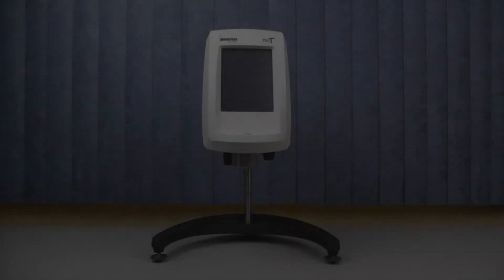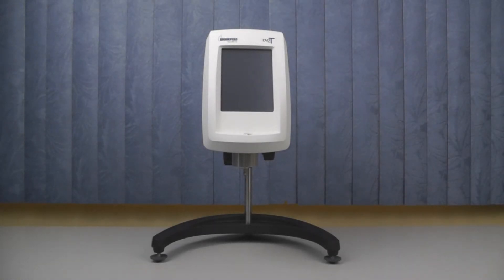In order for the viscometer to make accurate readings, the instrument must be leveled. Remember to level the viscometer prior to the AutoZero procedure, so it is a good habit to level the instrument before you power it on.